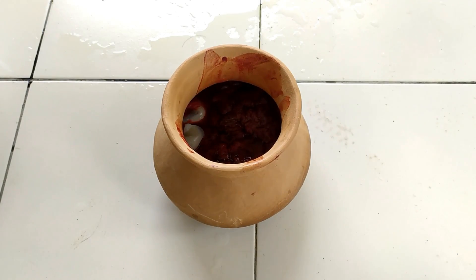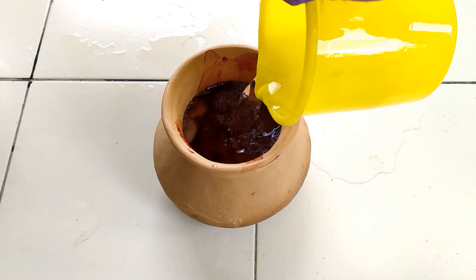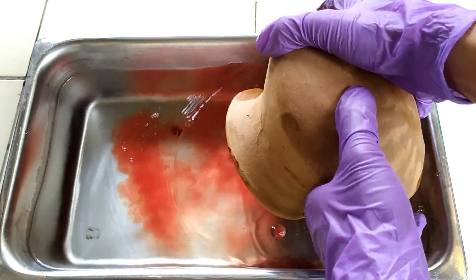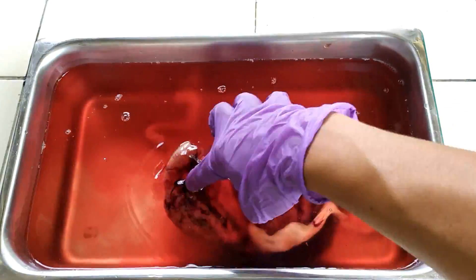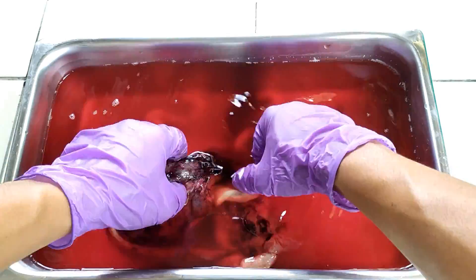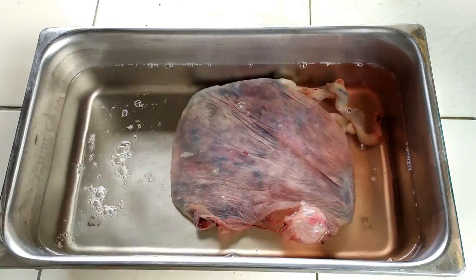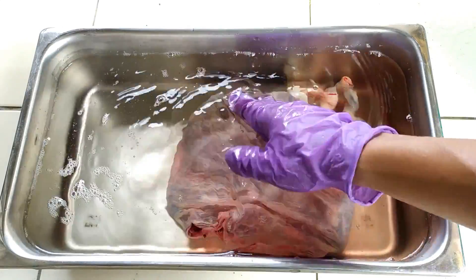Organs such as the placenta can be quite bloody considering the tremendously rich vasculature that they possess. So the first step in the processing of an internal organ specimen would be to thoroughly wash the organ — in this case the placenta — using copious amounts of fresh clean water. Five to six rinsings, even up to ten rinsings, is recommended with a change of water at each rinsing step. Once a majority of the blood has been washed off, which becomes evident from the water getting cleaner and less colored, you may proceed with the next processing step.